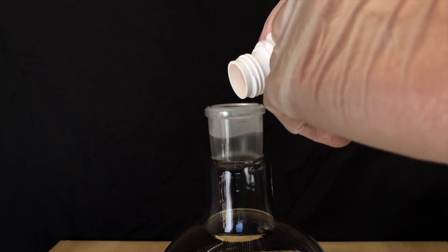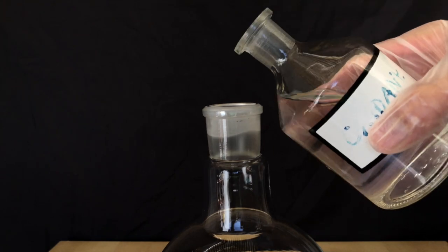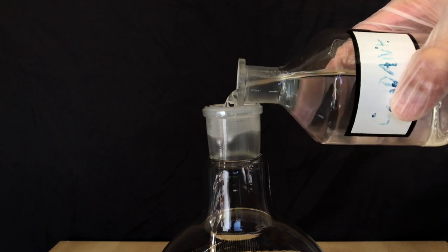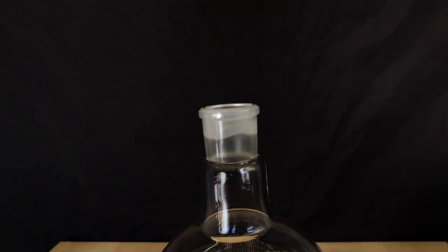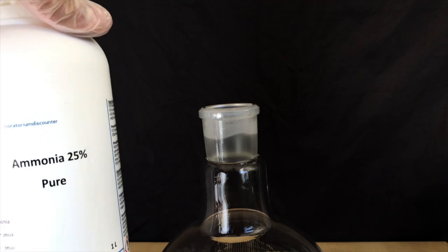A few granules of silver nitrate and a small amount of distilled water to dissolve the silver nitrate were added to a round bottom flask. Next, concentrated ammonia solution is going to be added dropwise.